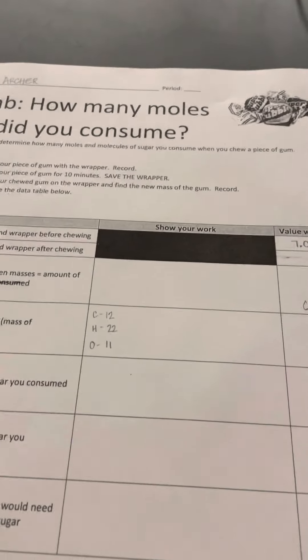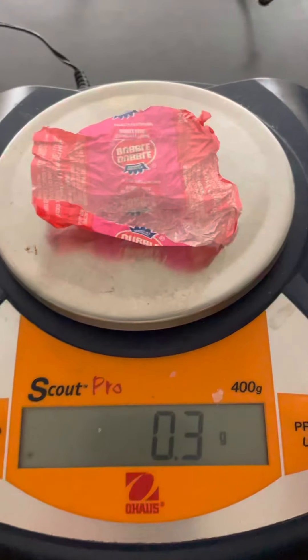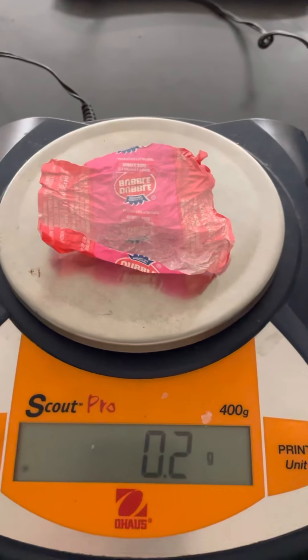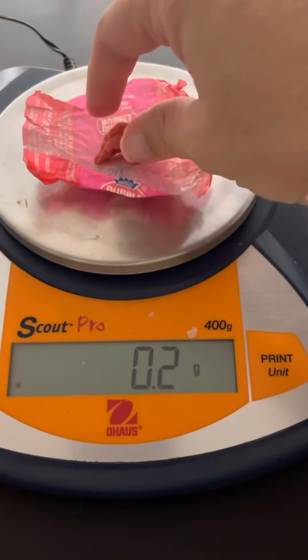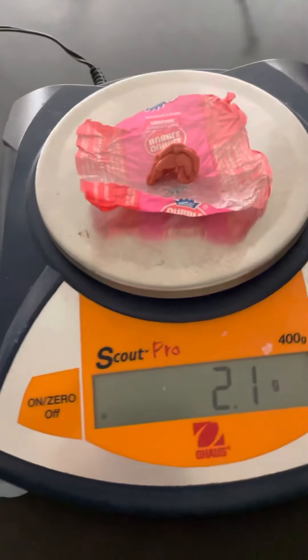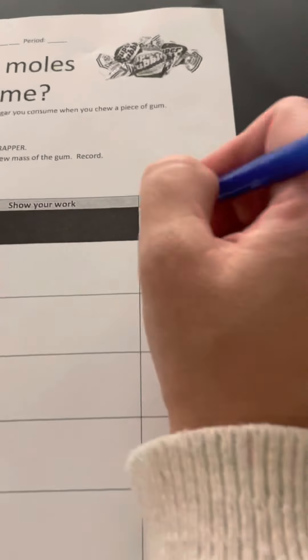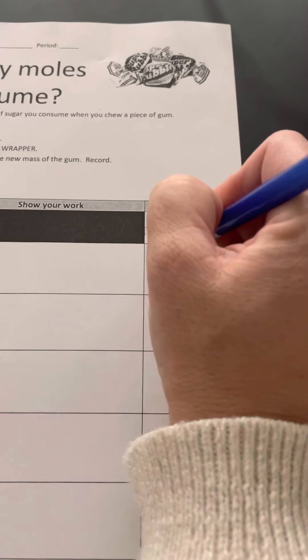So we're going to pause for just one second. I need to bring my wrapper back over here and put it on the balance. Here's the piece of gum I've been chewing for 10 minutes. My new mass is 2.1 grams — wow, that's a lot of sugar that I just consumed. So I'm going to enter 2.1 grams.